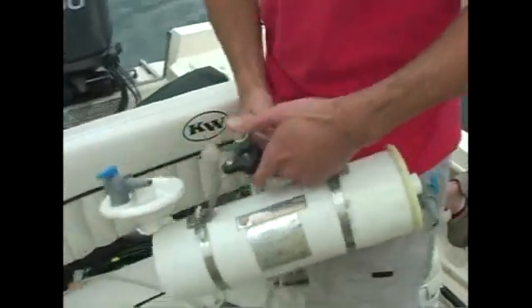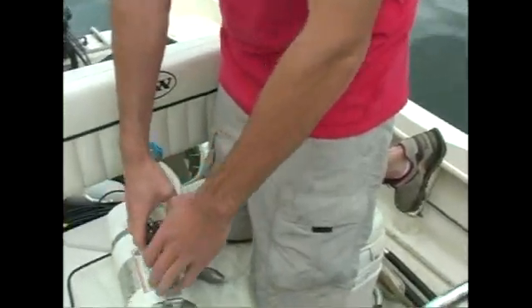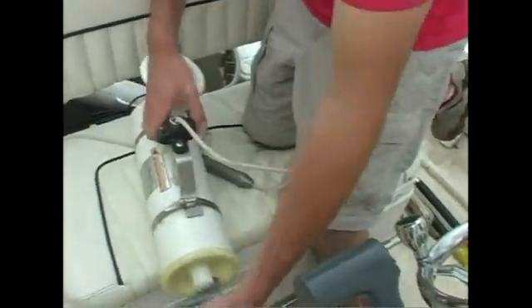So we're looking at about 11.8 meters. We'll generally take a sample about a meter off the bottom — you want to try to avoid getting sediment in the sample bottle — so we'll take about 11 meters, which should be sufficient.